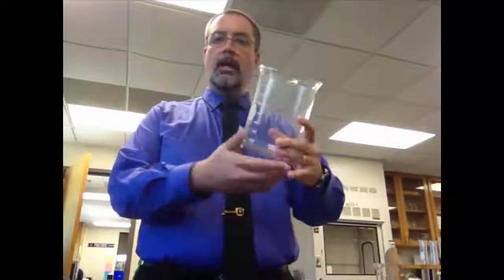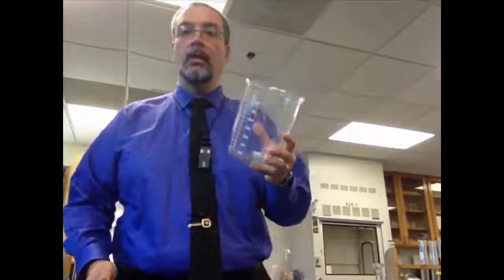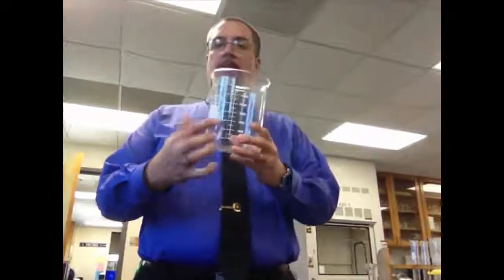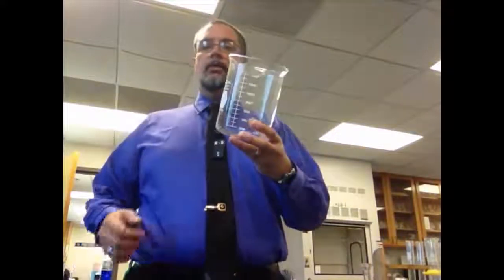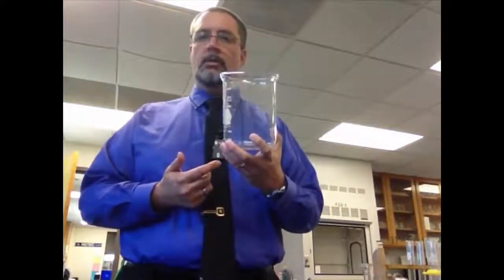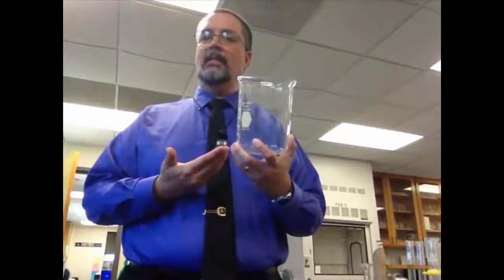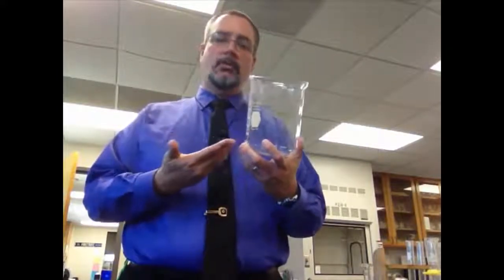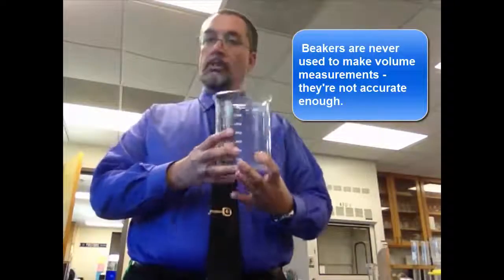A beaker is anything with straight parallel sides. It looks kind of like a drinking cup, although you never want to drink anything out of here. But it has straight parallel sides. Sometimes a beaker has numbers on the side of it. But we don't really use this scale. We don't use these numbers to do really anything important. It's just to give you an idea of about how much is in here. They're not very accurate. You don't really measure with beakers. Beakers aren't used to make measurements. Beakers are used just to hold stuff.